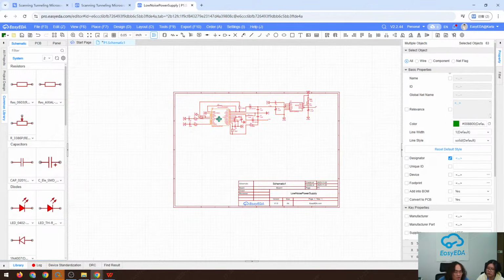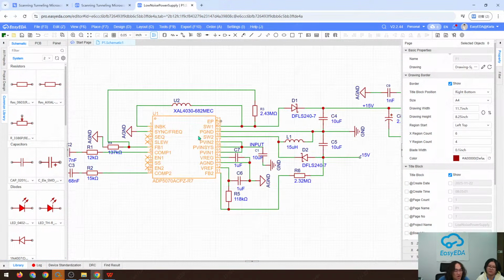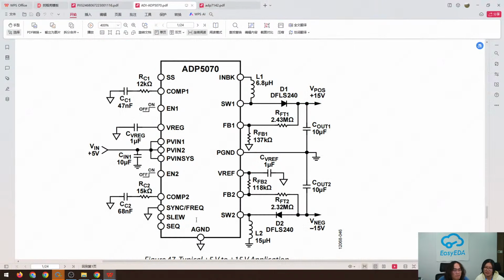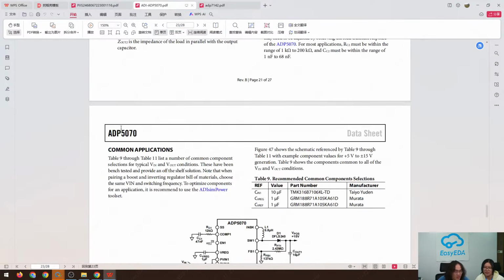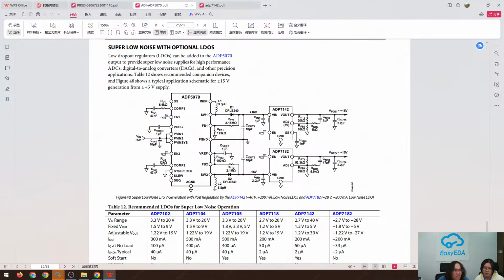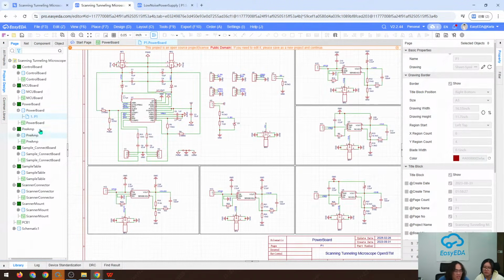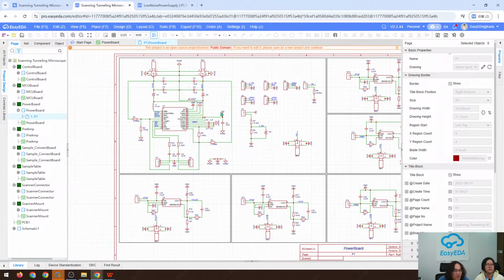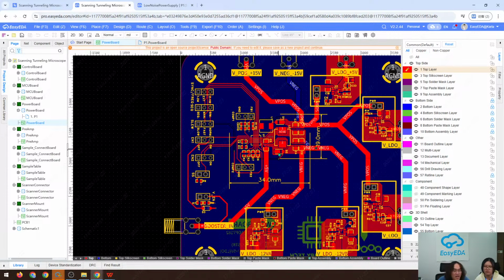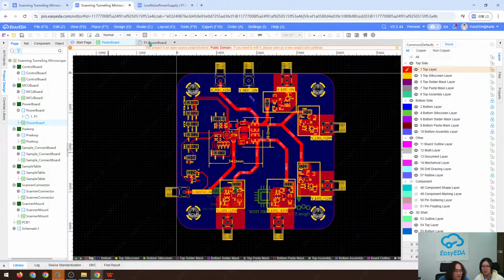Okay, we have roughly finished our low noise circuit design, and it doesn't cover every detail, so there may be some little mistakes. If you are interested in drawing a low noise power board, you can refer to the datasheet of the ADP5070, and on page 24 there is a very typical application circuit. You can refer to this circuit, or to my power board. Since it's open source, you can just copy and paste my schematic, even the PCB layout, and it's free and okay for your project. And that's the design of the power board.